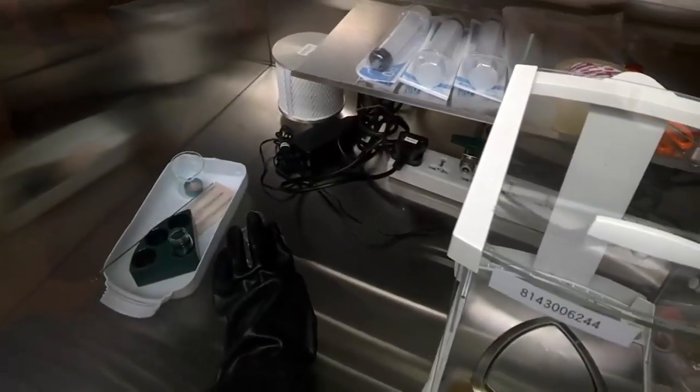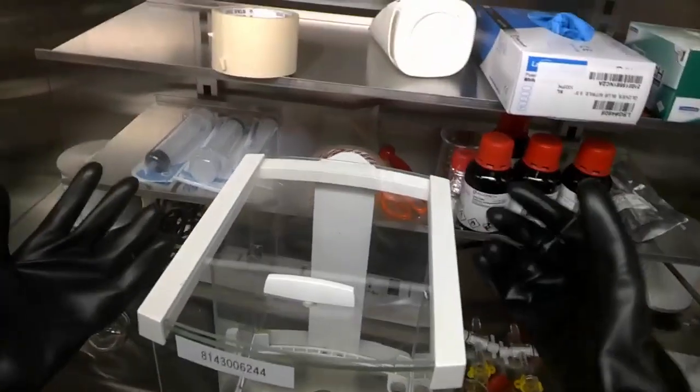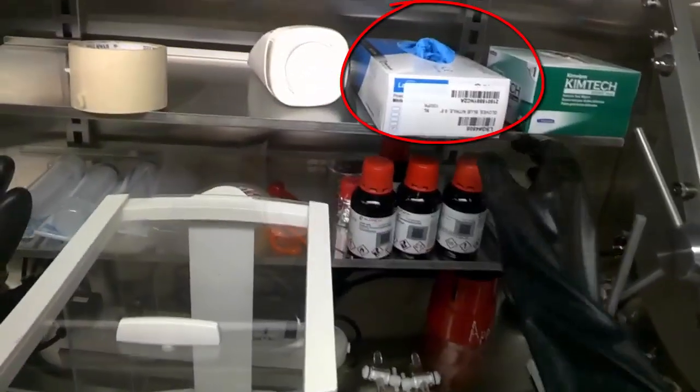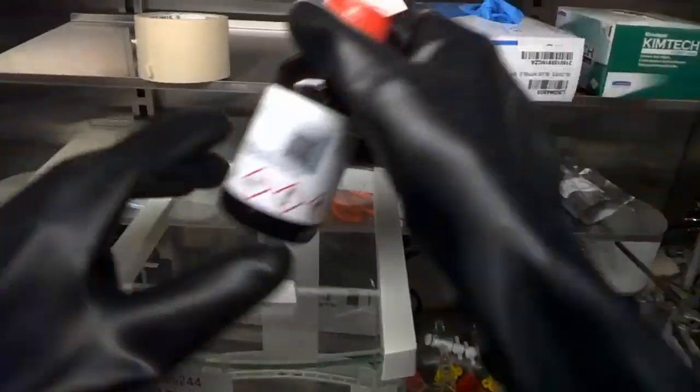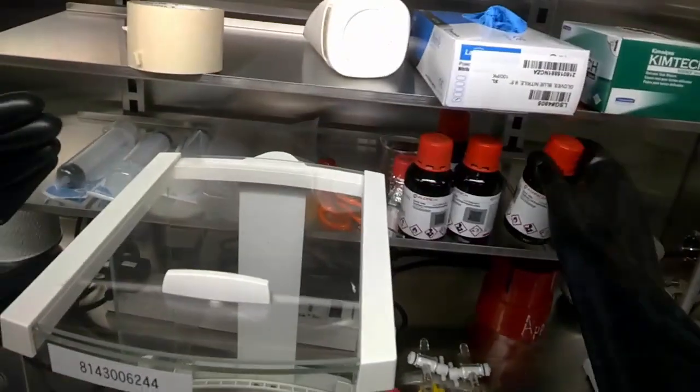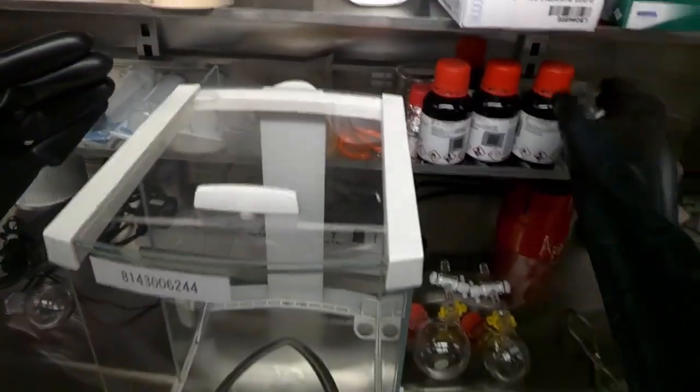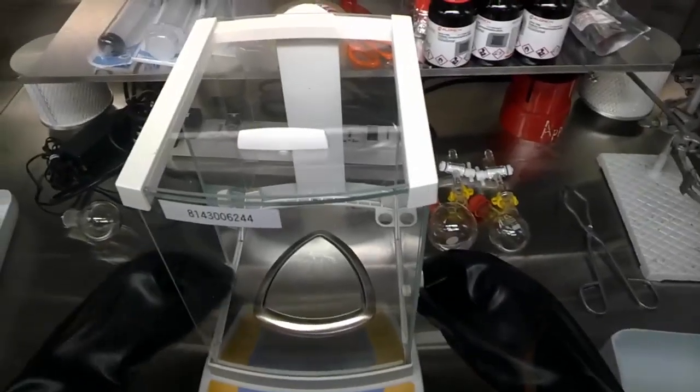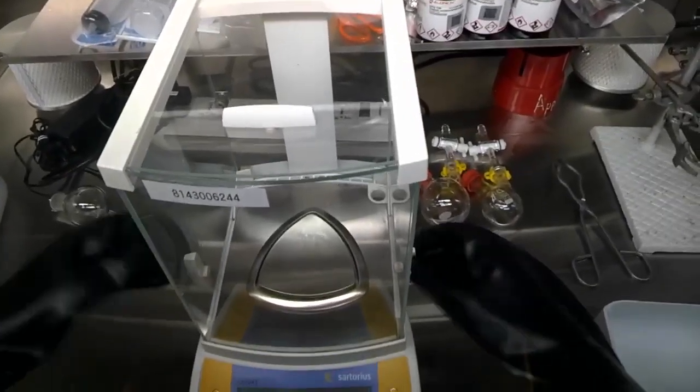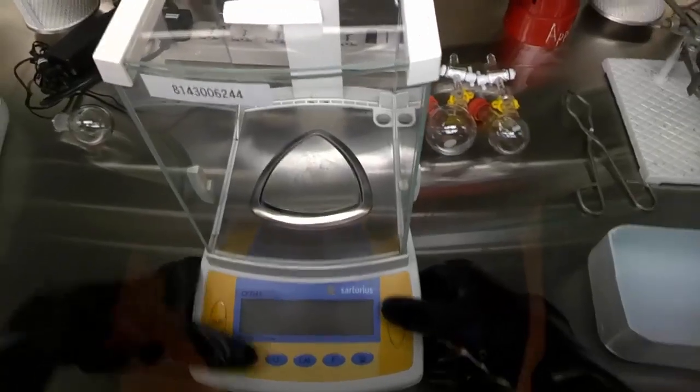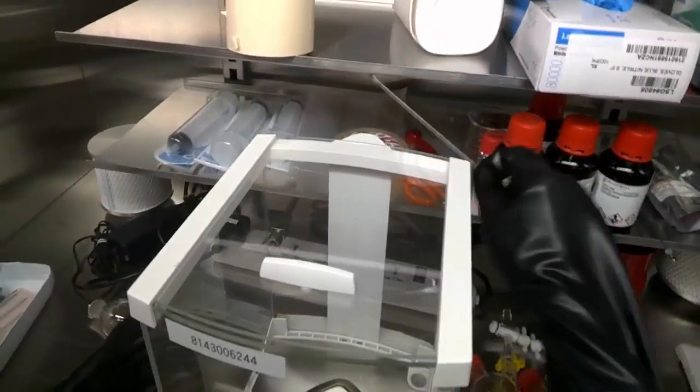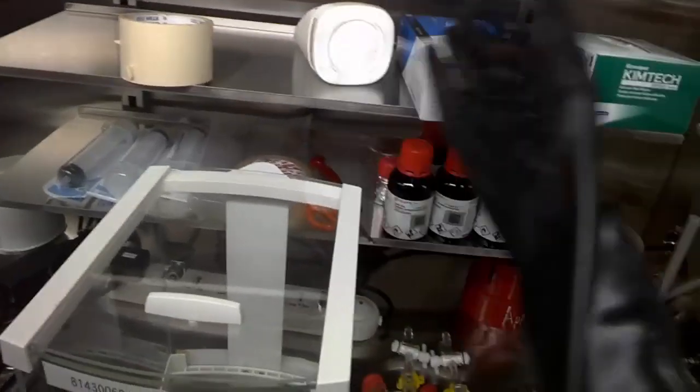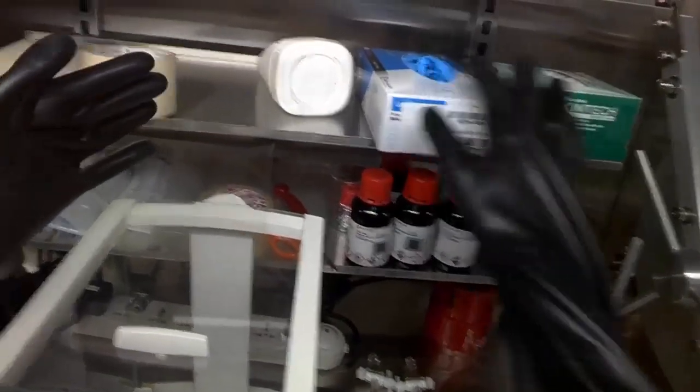Replace it here first. Suppose you need to do some weighing of chemicals. You have to put on the pair of gloves you see on the screen here. And after that you just do likewise, as if you're doing it inside the lab on the bench top. Just now we're having a more secure and clean environment. You turn on the balance. It's just the normal procedure. So you do not have to be afraid. See your spatula is here. Weighing papers around. Gloves. You have to wear them. Kim wipe. Whatever you need. It's all inside.